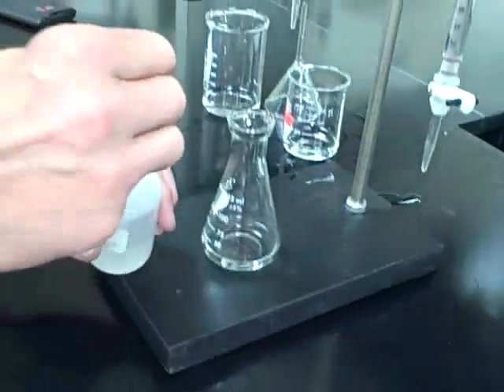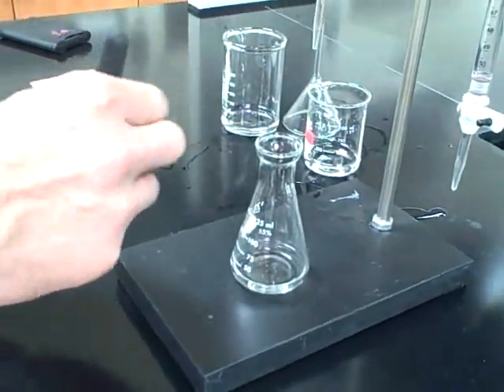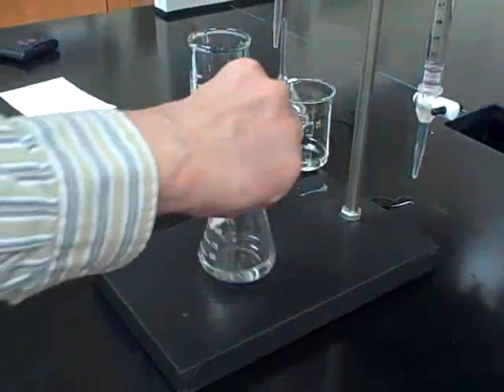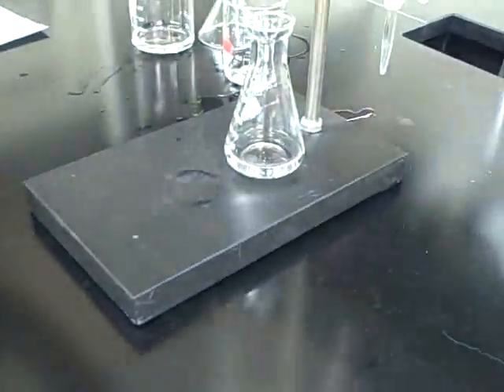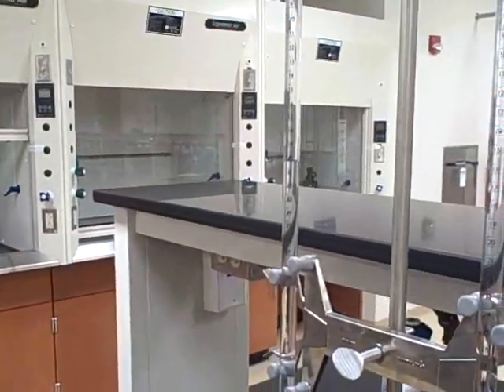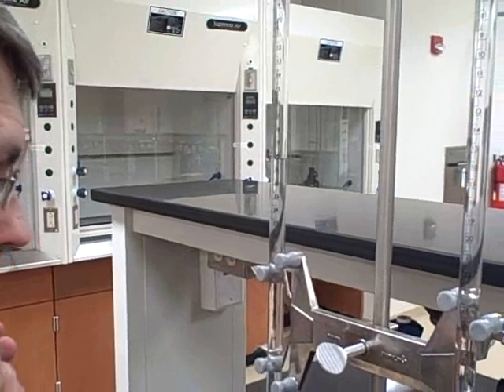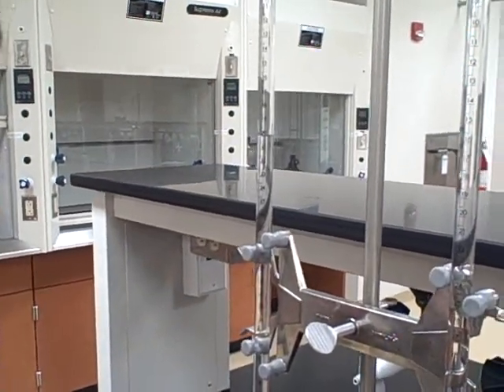Now I'm going to stop at about 20 and put in a drop of indicator. We use a phenolphthalein indicator that only needs one drop — it's clear when it's acidic and pink when it's basic. Now I need to write down the volume here because that tells me how much acid I put in. It looks like 20.05.